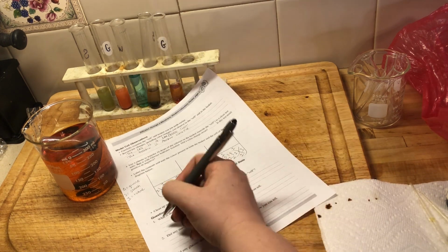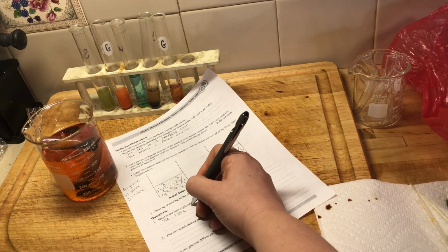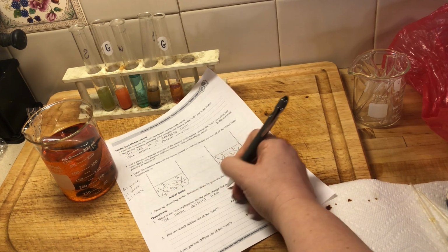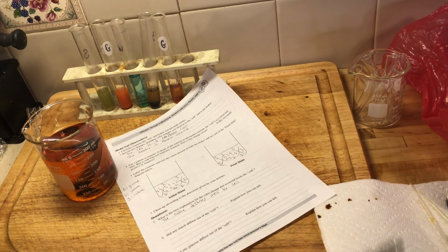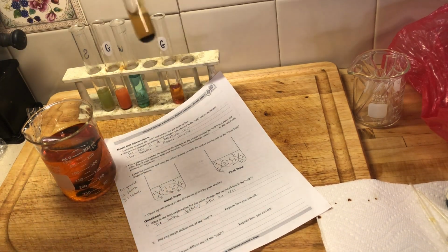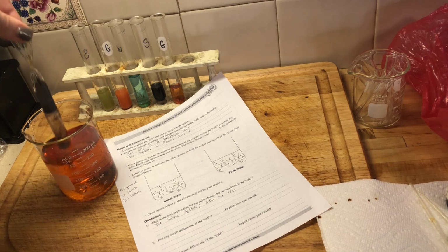So the iodine diffused into the cell. Does that make sense? Iodine diffused into the cell. We learned from our chemical testing that the way we can test for starch is with iodine, and we get a color change, which is what we got here. We got our color change in our cell.